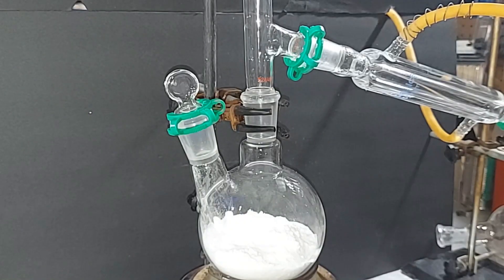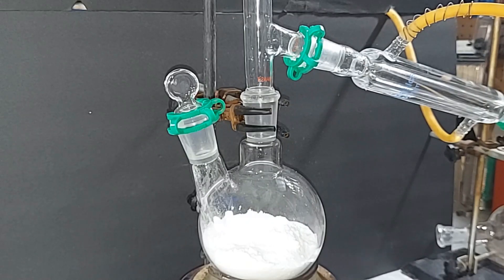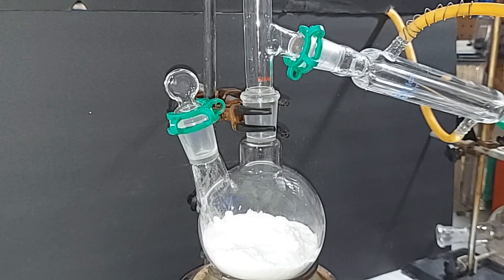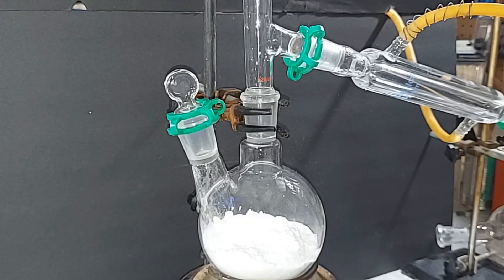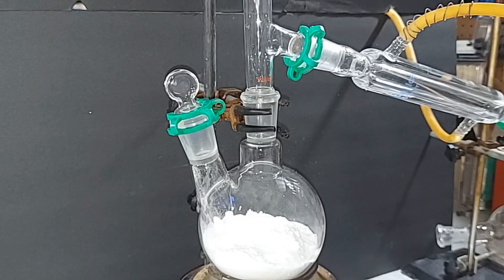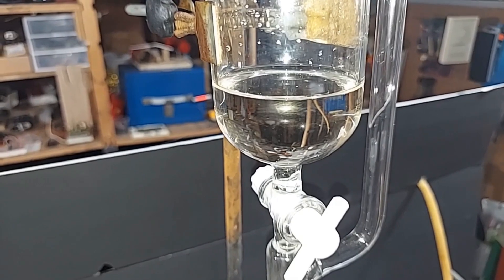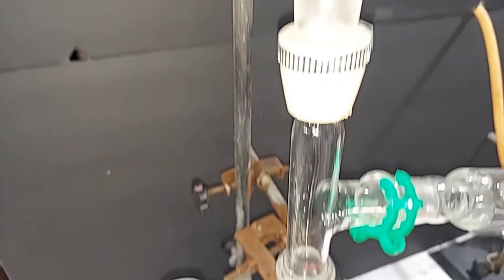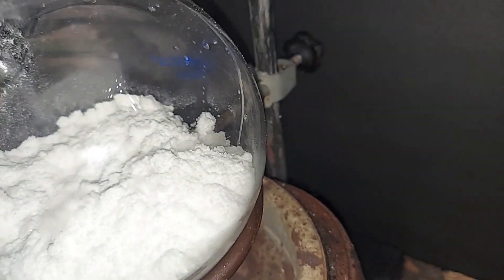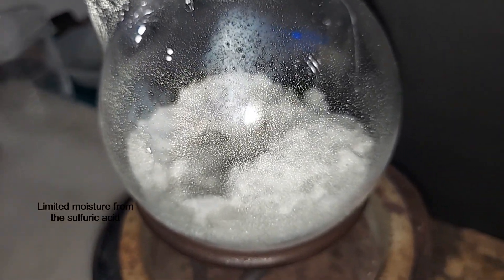I'm starting to add the sulfuric acid dropwise. Remember, this is an exothermic reaction and it will heat up quite a bit on its own — I will not be adding extra heat until all of the sulfuric acid has been added. The first few drops are coming in. About 25 mL has dripped in; it's riding the back of the glass rather than dripping down the center. You can see steam gathering inside the glass from the exothermic reaction.